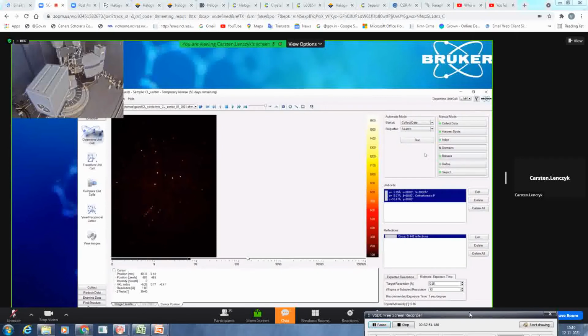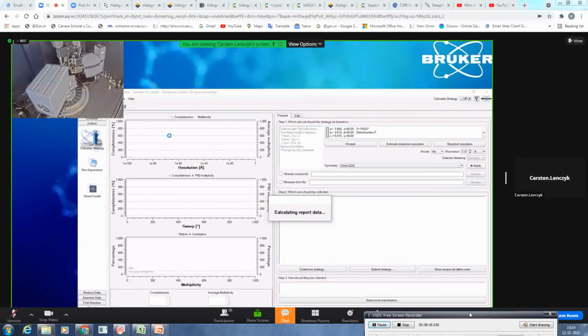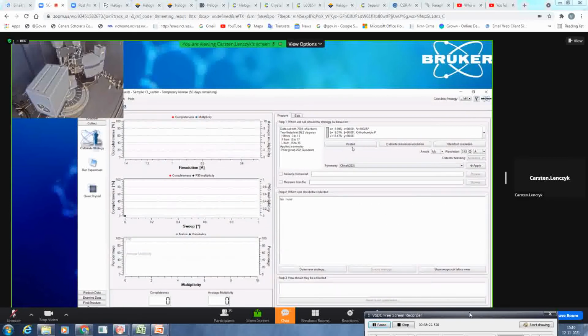Okay, with that, we are basically done with the determination of the unit cell and checking if it's already published. So we can close it. And the next step is, okay, we are happy with what we saw, so now we would go to calculate strategy. If you open it, the instance of Apex will communicate with the instrument to get hardware feedback. What we now do is click restart.